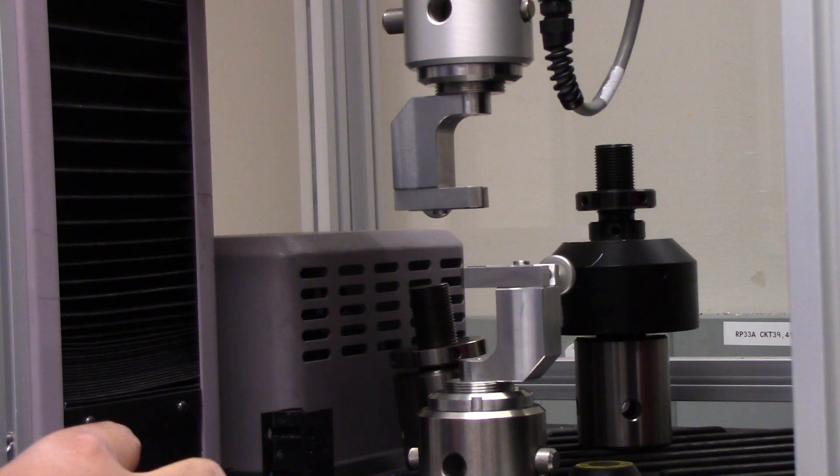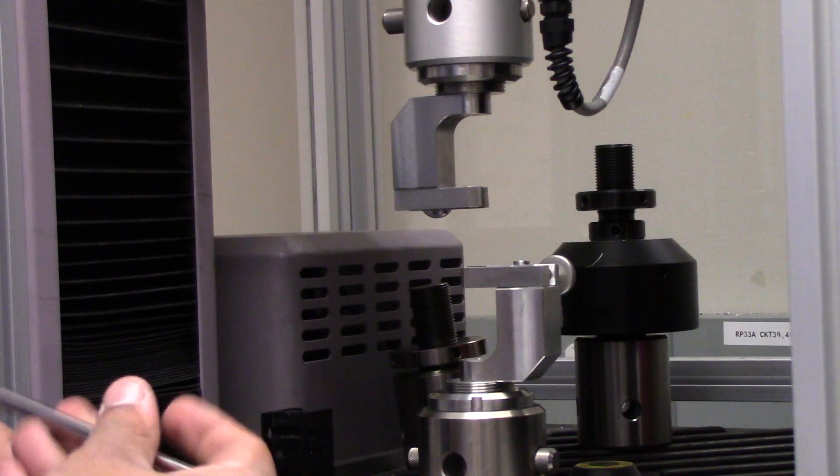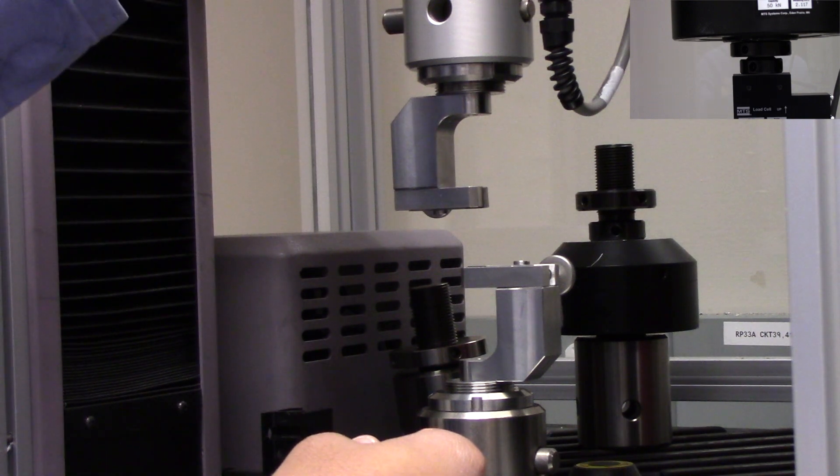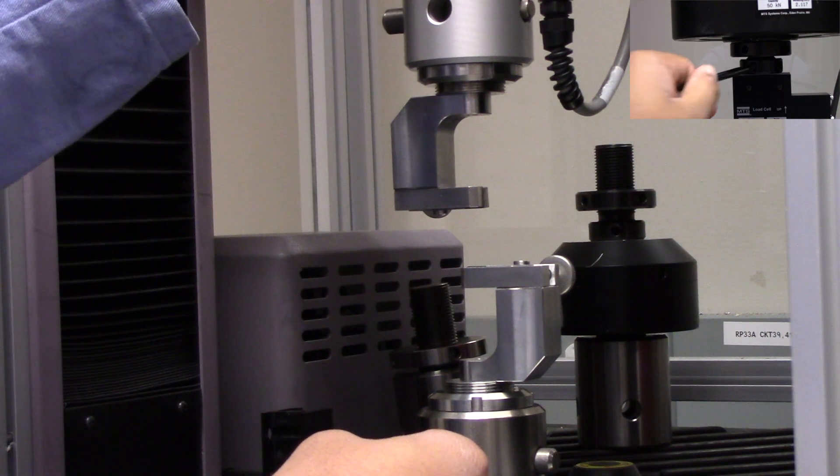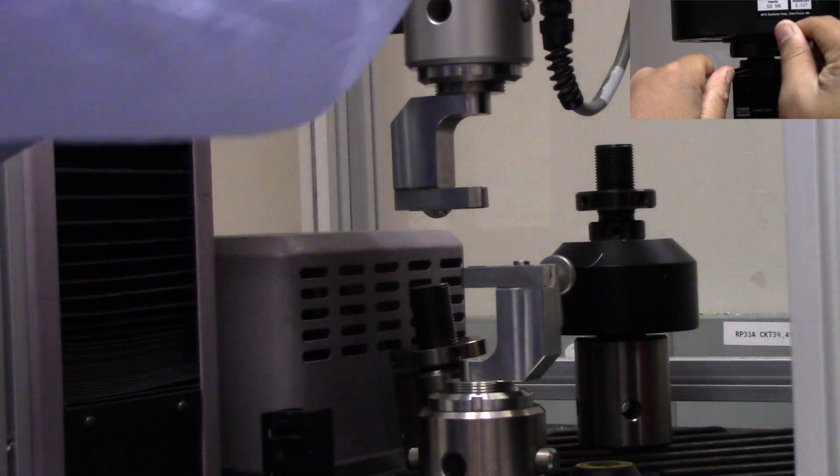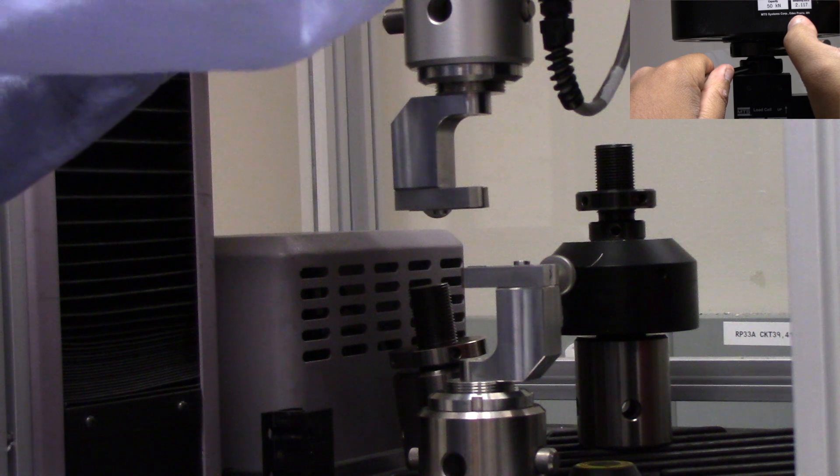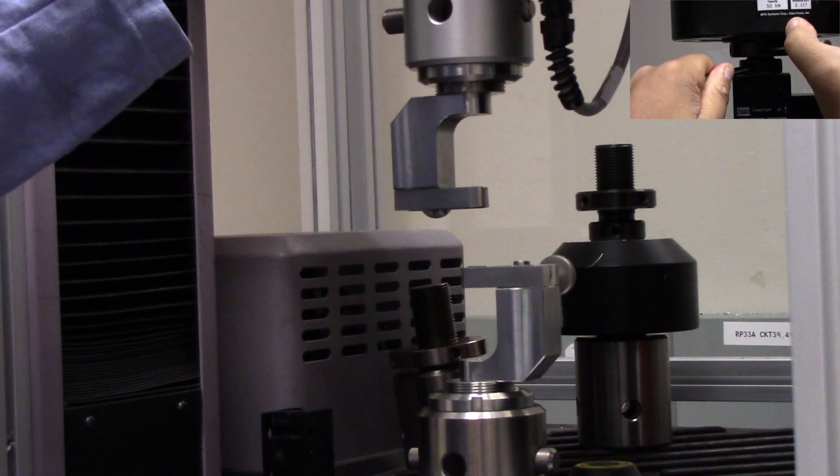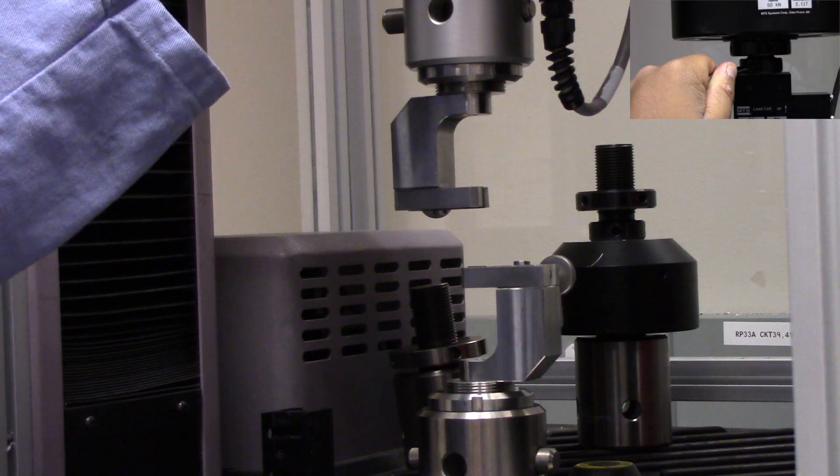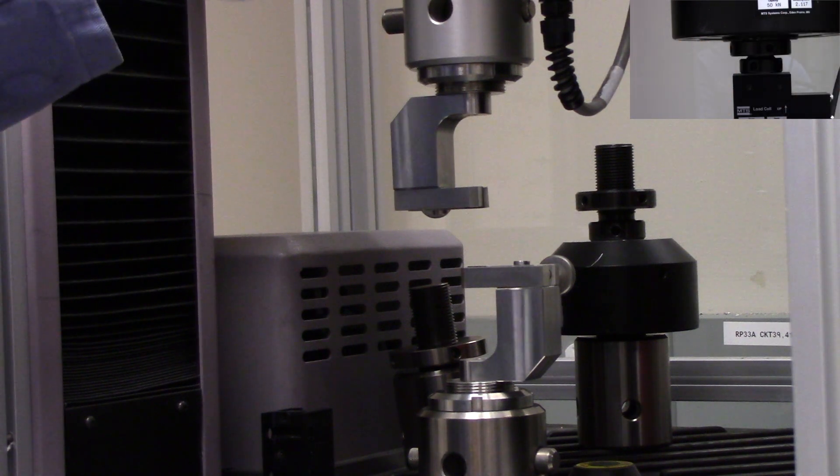So, to tighten this junction, place one rod into the lower lock nut, and then you're going to place another rod into the upper lock nut. While keeping the lower rod steady, tighten the upper lock nut by rotating it counter clockwise. Make sure that you make it nice and tight, as sloppy load frames lead to big errors in displacement. So, let me go finish that up.